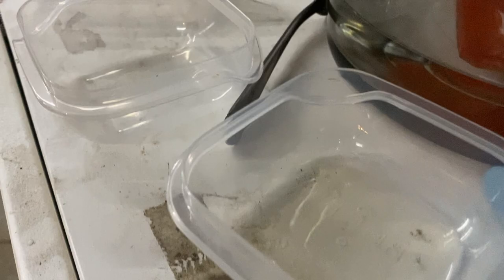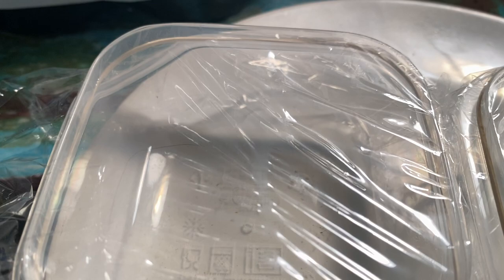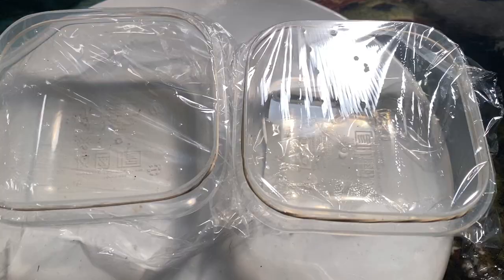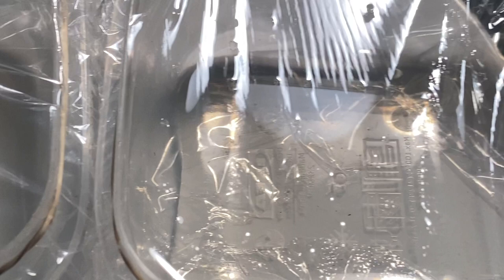It was washed for about a week — I'm speeding through that here. We put it in a centrifuge, and this is the result after 30 minutes of centrifuging, a week of washing, and drying in a container. Make sure to stay tuned. I have the film to show in class today — it's somewhat ready, but we haven't figured out how to put an image on it yet. I accidentally poked a hole in it, but most of it looks pretty good. Thank you very much for watching, and stay tuned.